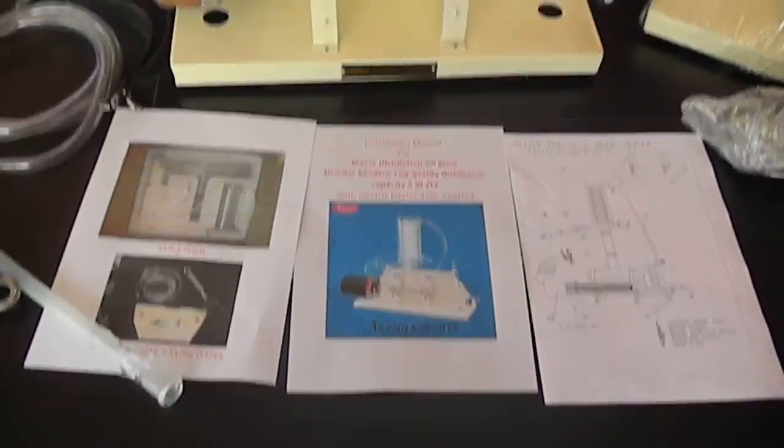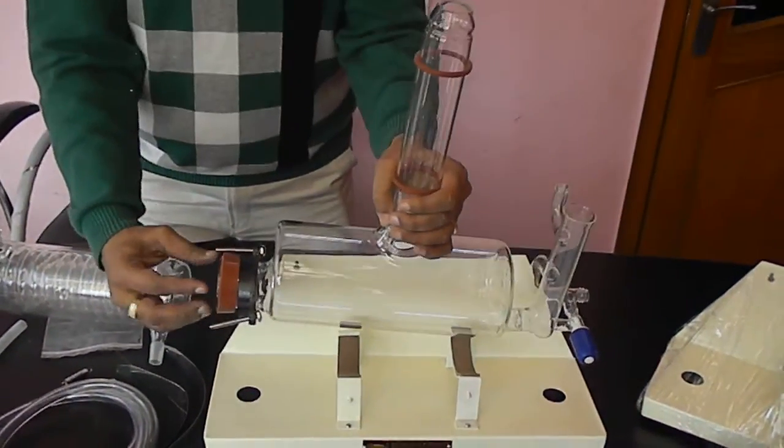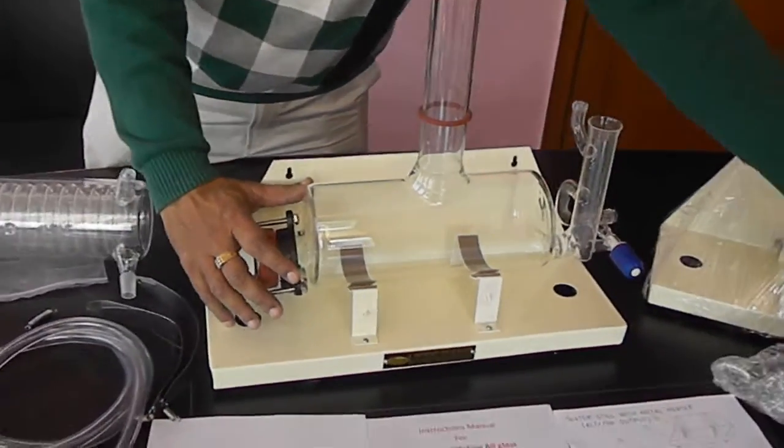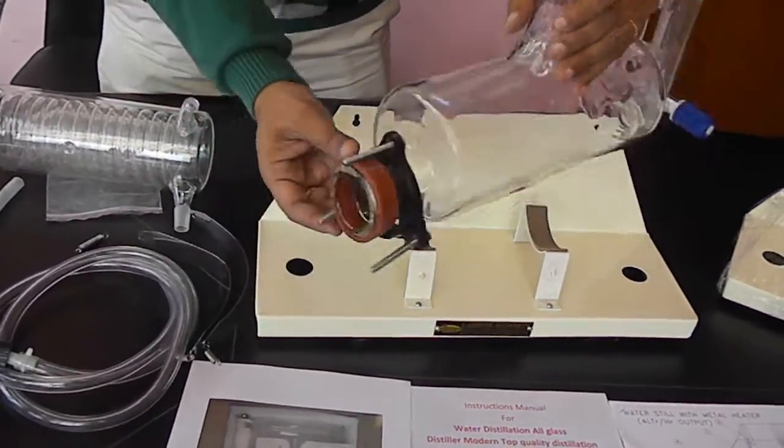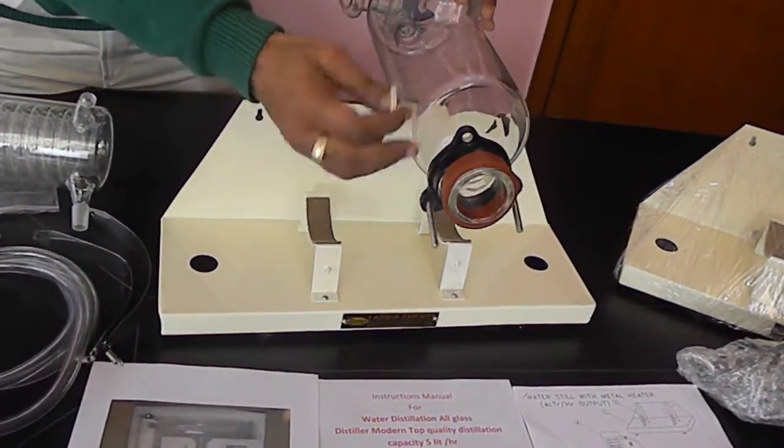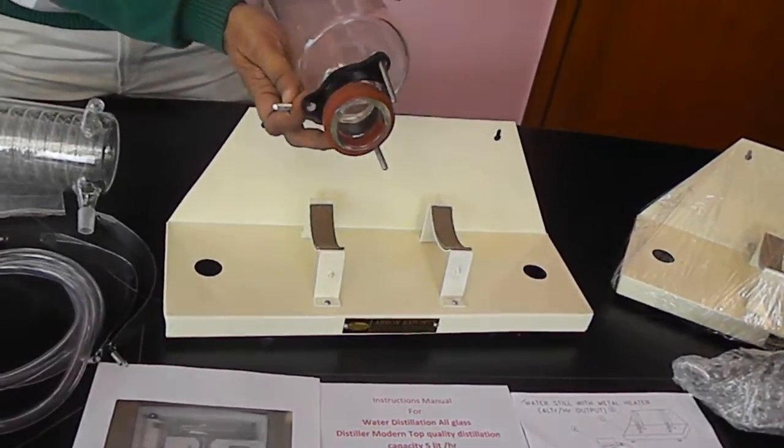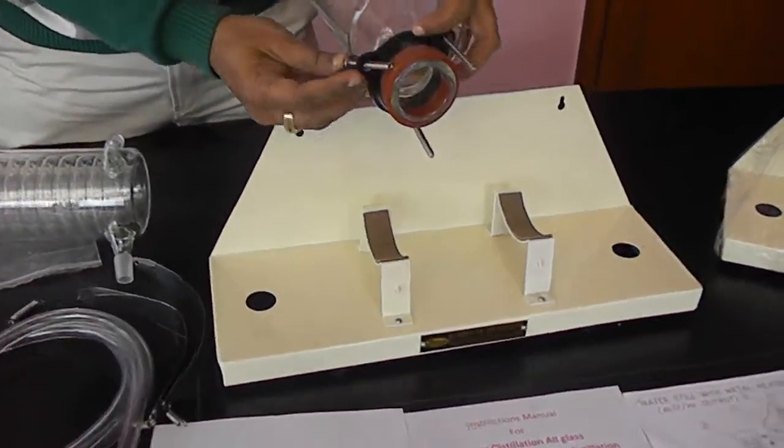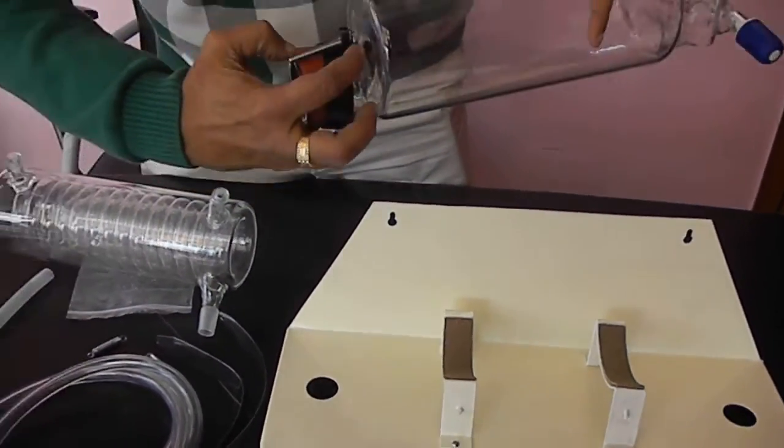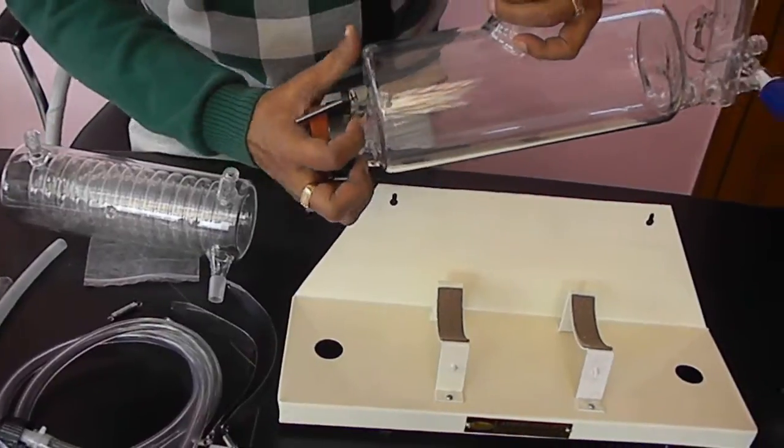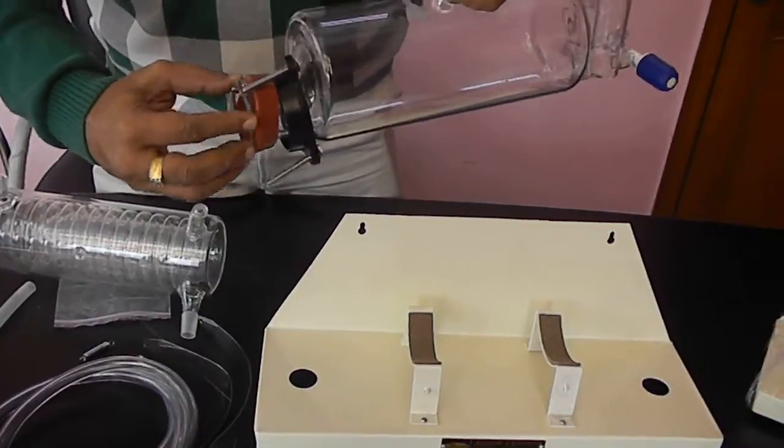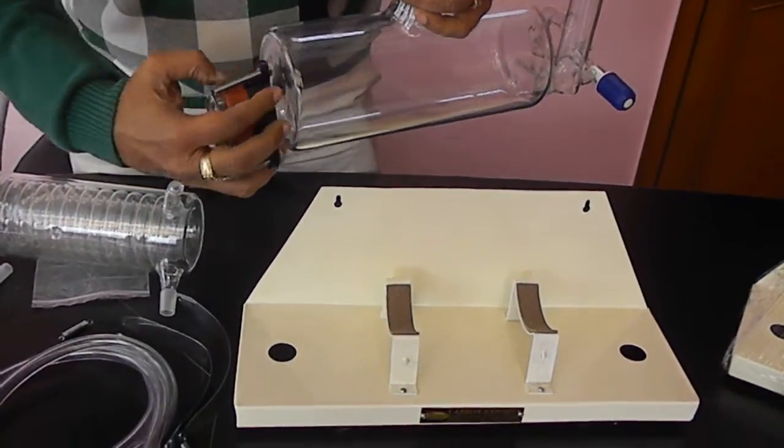First of all you have to assemble this part. We have a rubber tube. In these parts we can put all stainless steel screws from the bottom. It will not go from any other place except this bottom. Then we put the rubber gasket, then slide it so that it secures the part and assembles and fixes it properly.